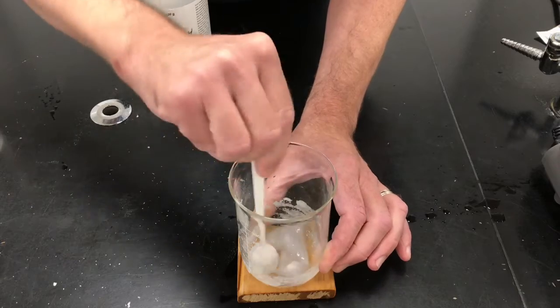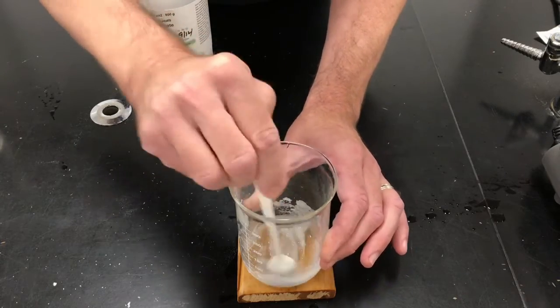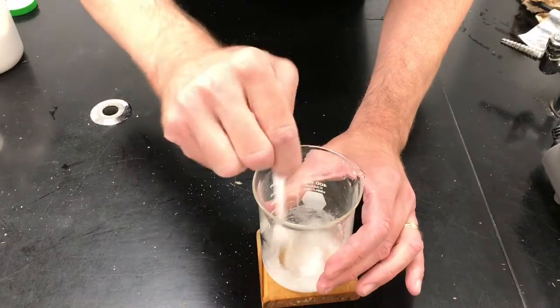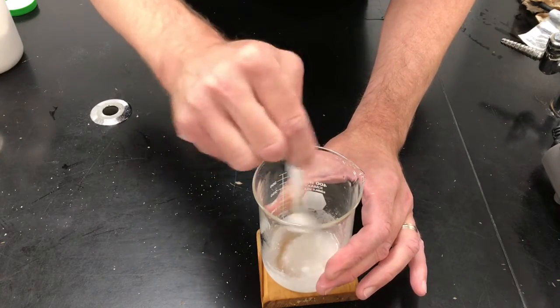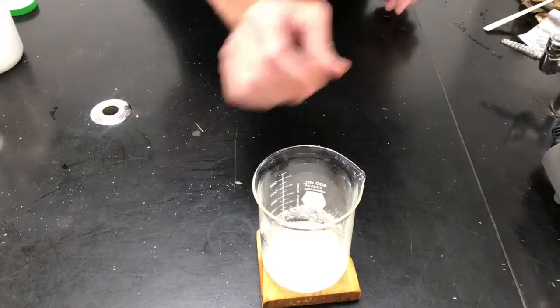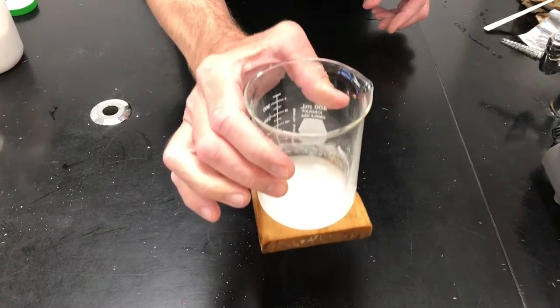Slushy, changing, suddenly we have kind of a liquid form. This came from two white crystally powders, right? All right, so I've been stirring here a while. Got that nice and reacted.